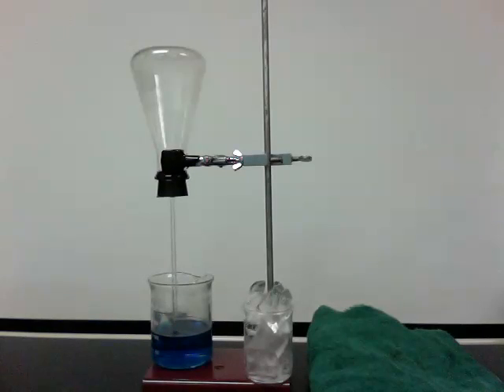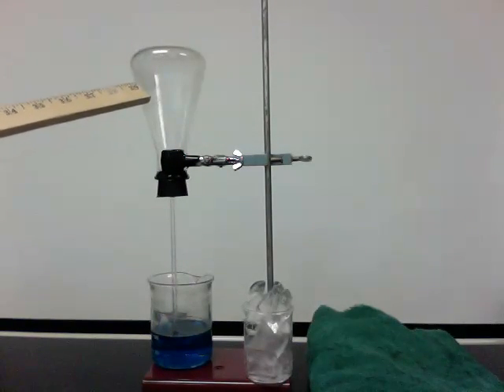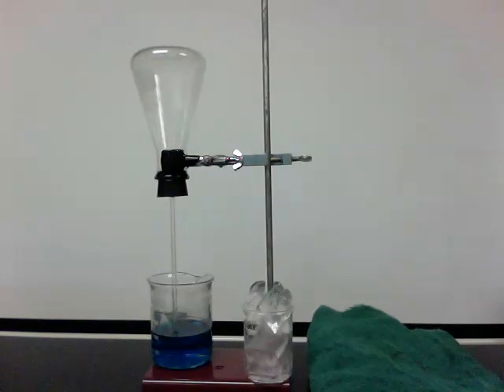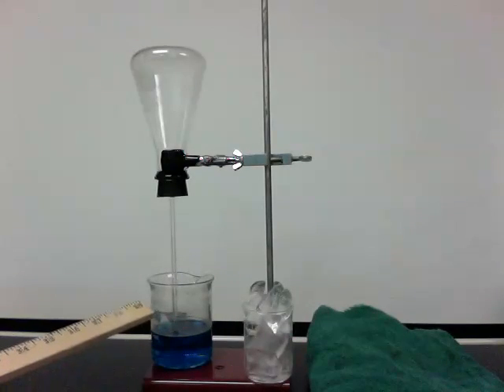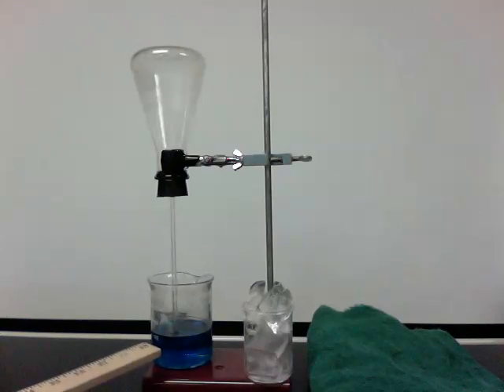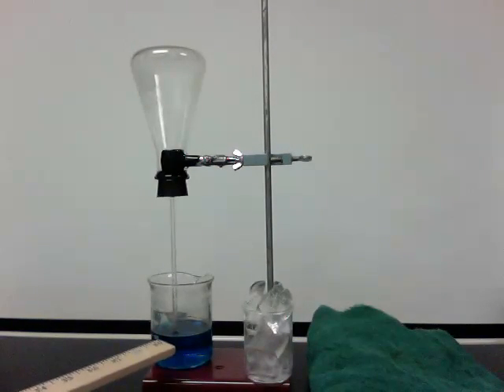We have a 250 milliliter Erlenmeyer flask and a 250 milliliter beaker containing 100 milliliters of water that has been dyed blue with regular food coloring — about two drops.